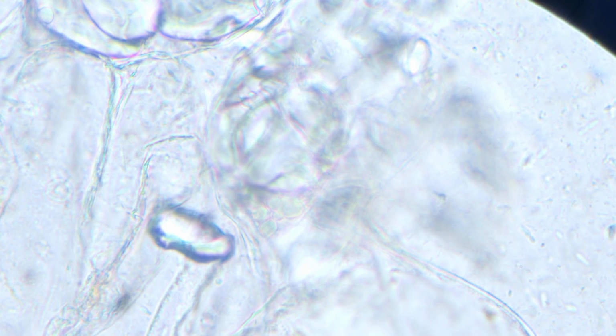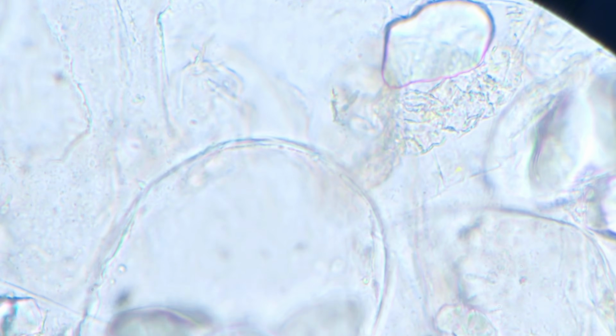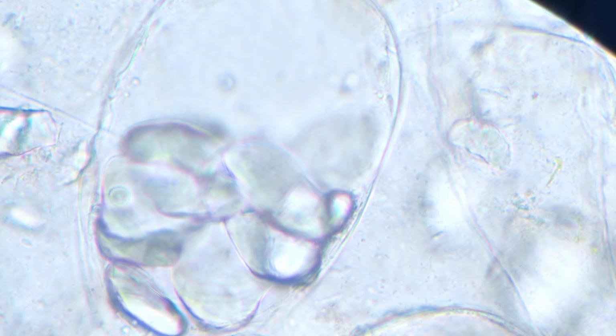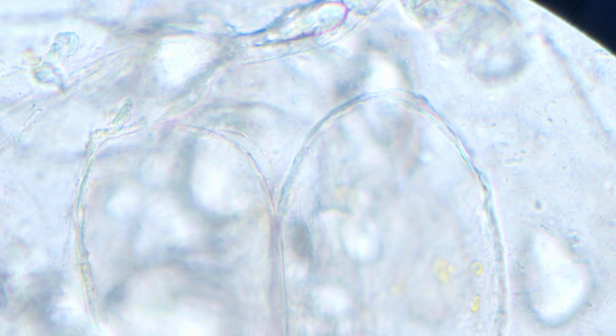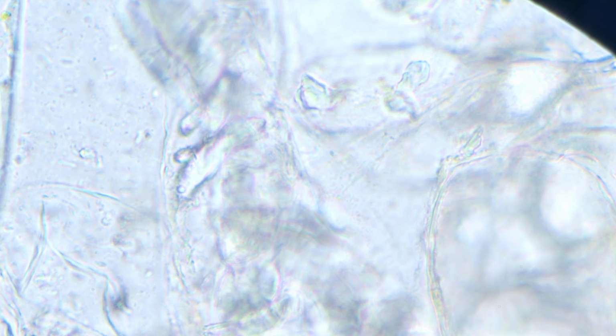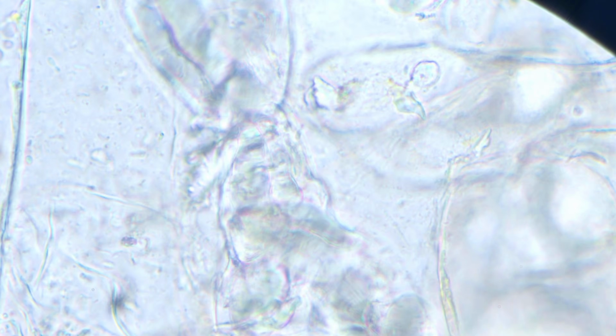Can't seem to find anything here, and I'm so surprised because I also don't like the rotten banana or even the overripe part of the banana. Interestingly, you find some people who really love it. I hate that part. Chances are very high that you might find a maggot there because those are fruits. That's food.